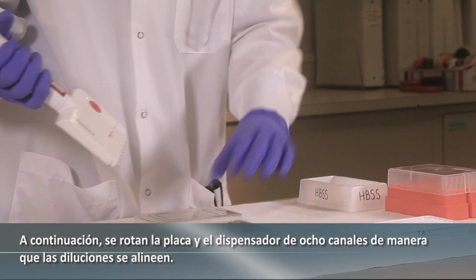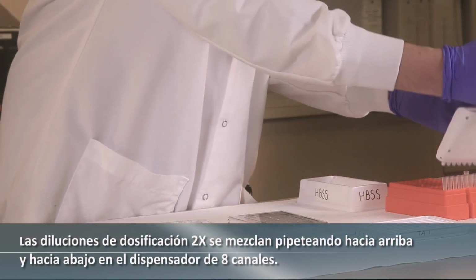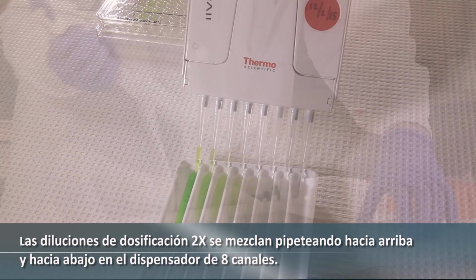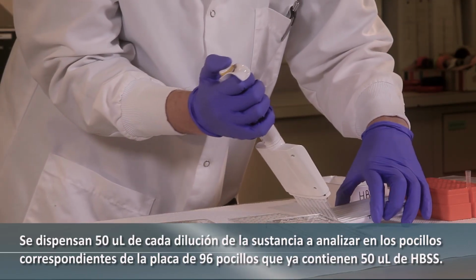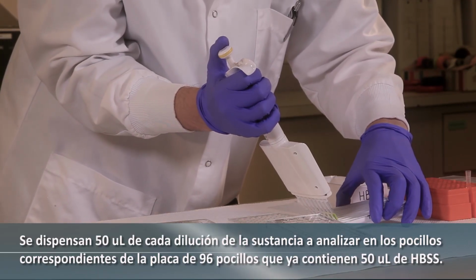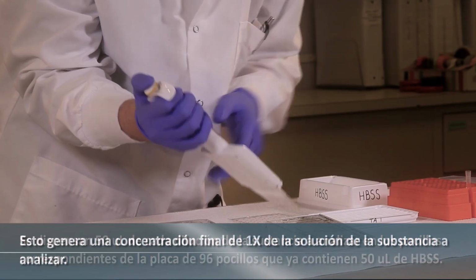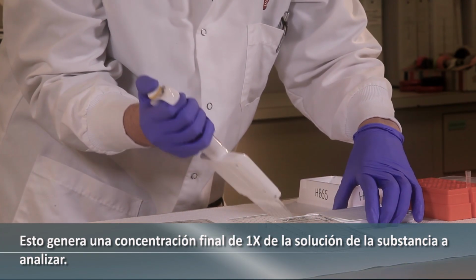Next, the plate and 8-channel reservoir are rotated so that the dilutions align. The 2x dosing dilutions are mixed by pipetting up and down in the 8-channel reservoir. 50 microliters of each test substance dilution are dispensed into the corresponding wells on the 96 well plate, already containing 50 microliters of HBSS. This yields a final concentration of 1x of the test substance in solution.